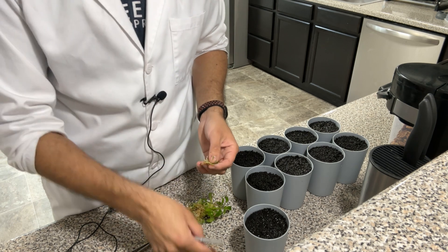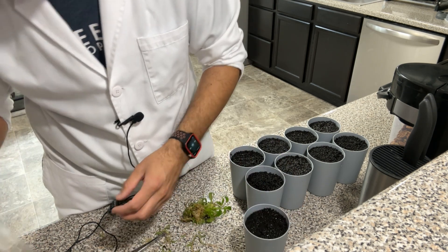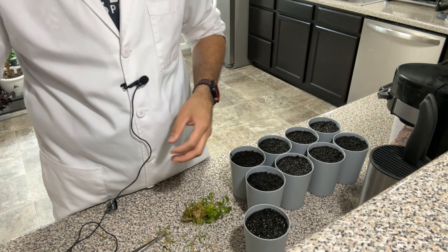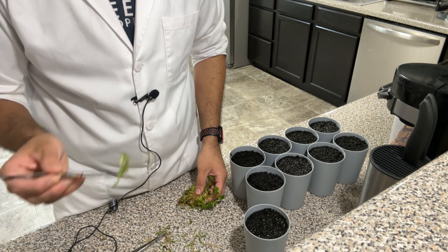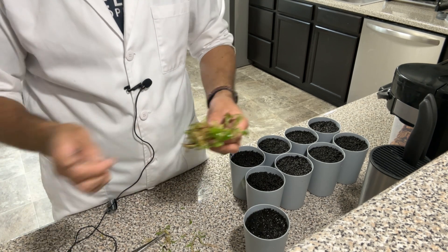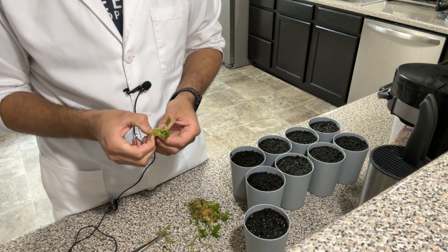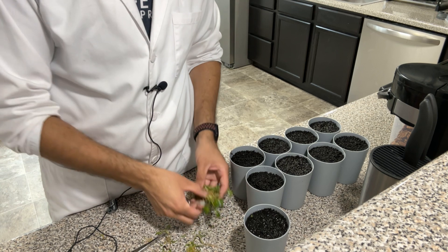The multiplication rate was still great. This flask was made on 7/12 — July — starting with just one plant that looked like this. I don't want to count them all, but I probably have well over 100 plants now in here. Very good multiplication rate.